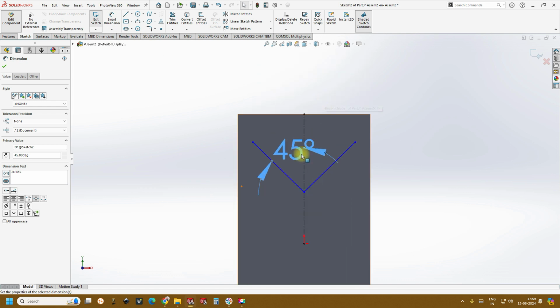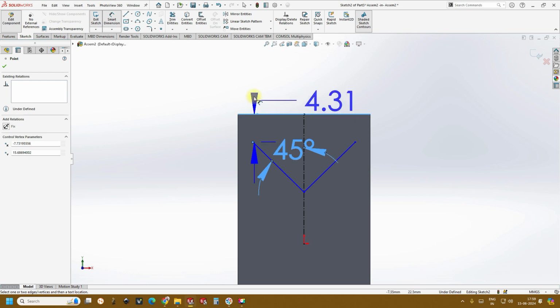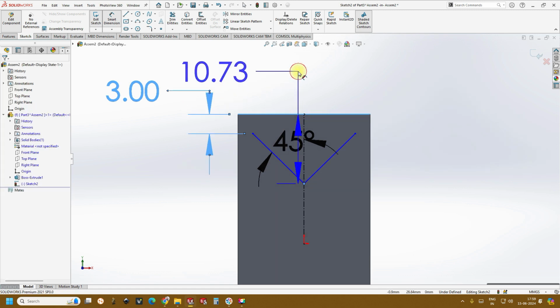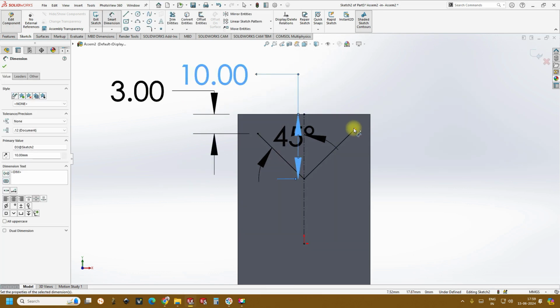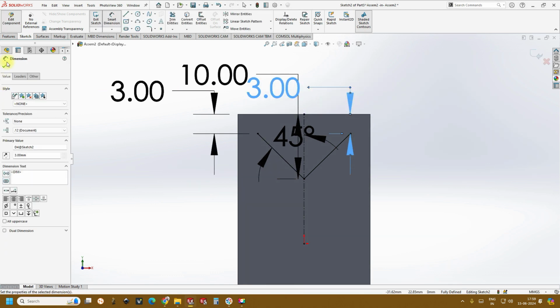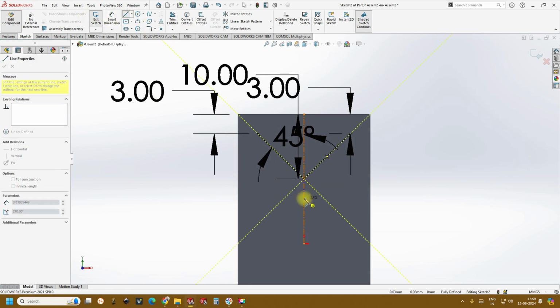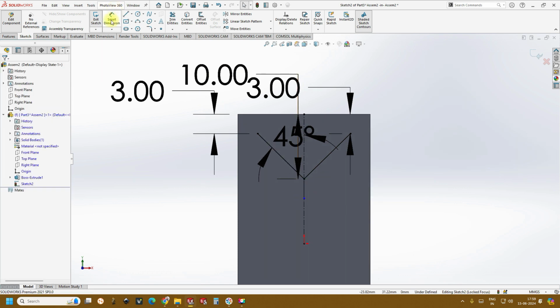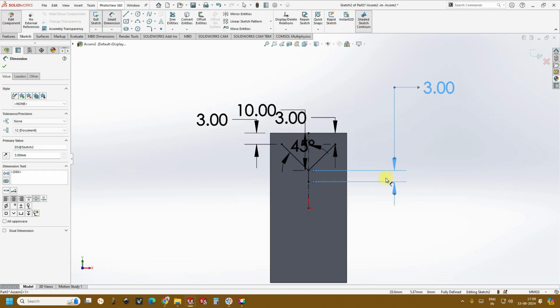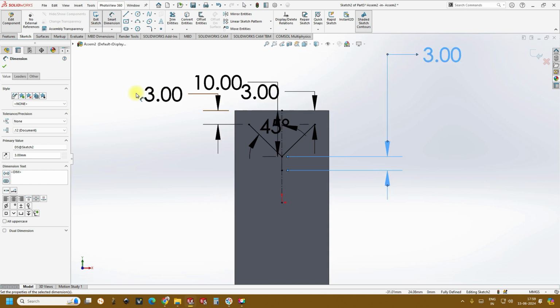Okay, and once it is done, so let's give 3 mm, and this close to 10 mm. Again this is somewhere 3 mm. Okay, and all these units are arbitrary depending on your needs. You can change the units. Take a second line and create another line, and this line is somewhere 3. Okay, so now we have created the Y, and the next thing is integrating the serpentine channels with this.